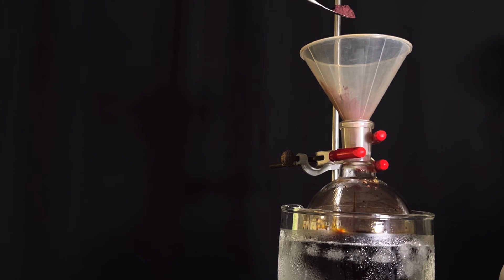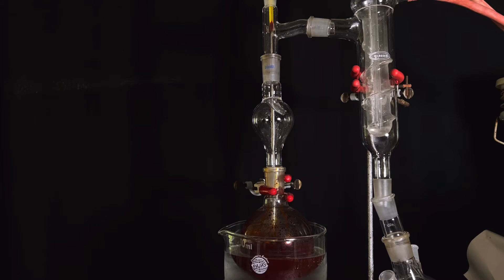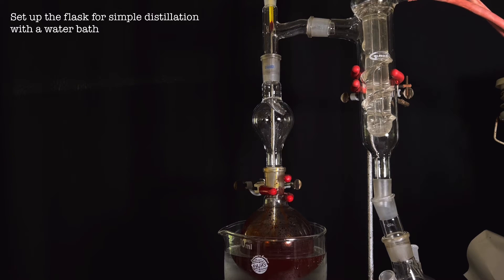The reactants used for the synthesis are also expensive, so we can't afford to lose even 1 ml of the product. Once all the red phosphorus is added, the ice bath is replaced by a water bath and a distillation setup was assembled.